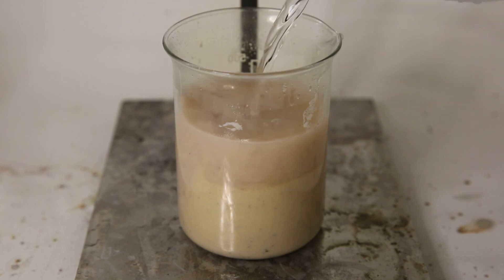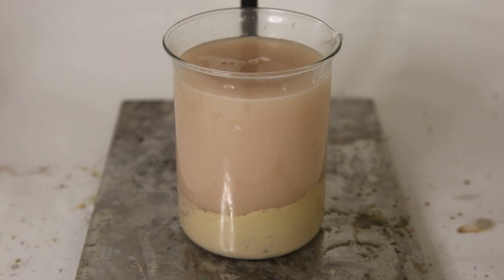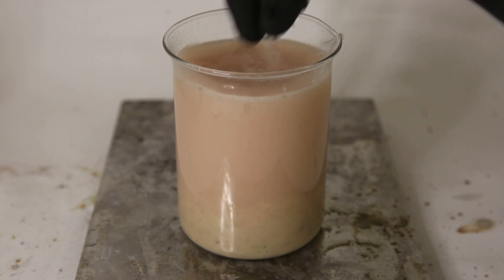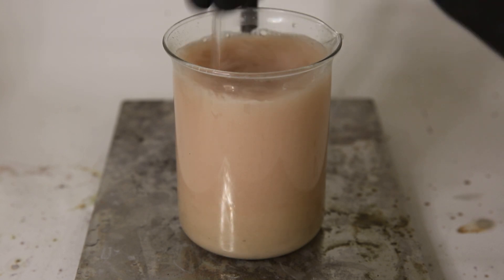When the reaction is pretty much complete, I top the beaker off with water to make sure all the silver nitrate dissolves and then leave the insoluble impurities to settle.